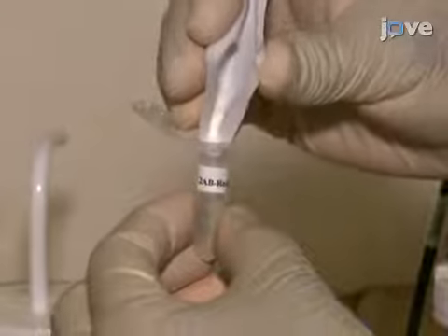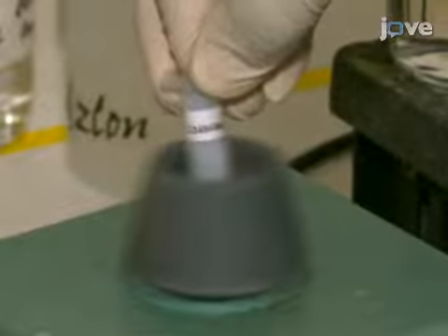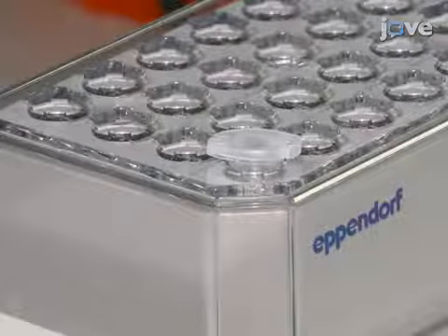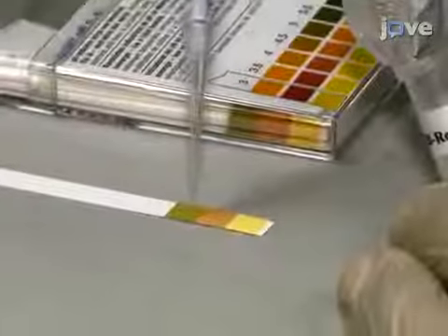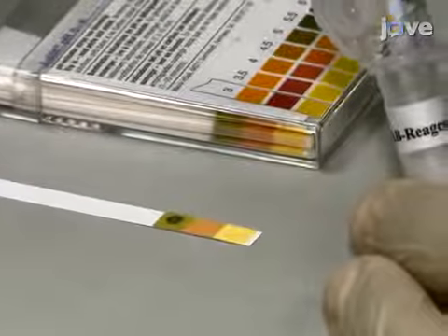Prepare a 1 molar sodium cyanoborohydride solution in 1 milliliter of water. Then, dissolve 27.2 mg of 2AB reagent in the sodium cyanoborohydride solution by heating at 65 degrees Celsius and adjusting the pH of the reaction mixture to pH 5.5 with 10% acetic acid.